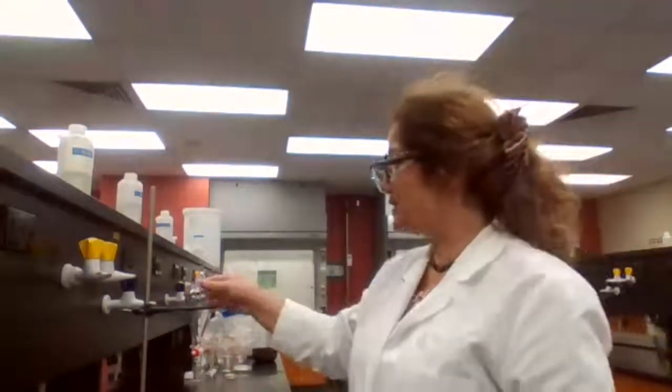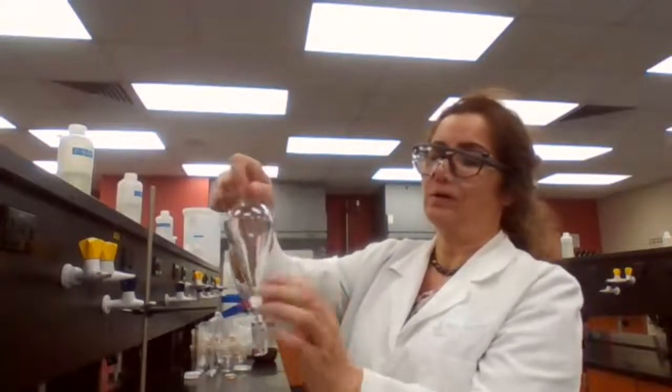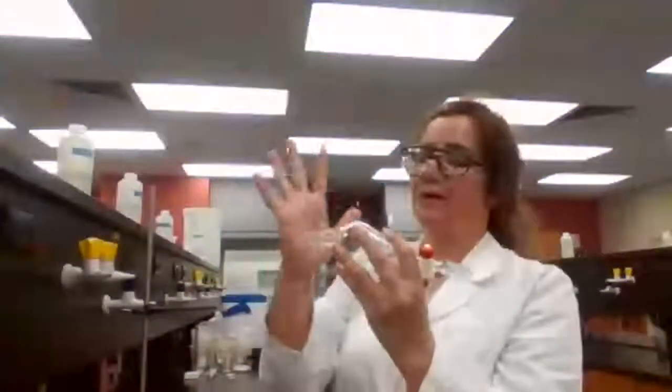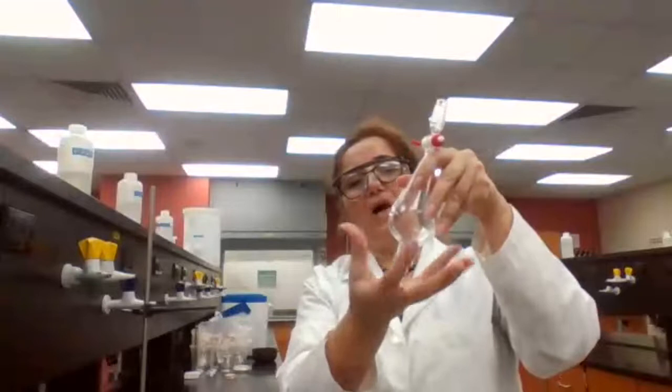But consecutive extraction means that first you add your extracting solvent, and then you are going to shake it. Make sure the stopper is greased and closed, and the stopcock is closed. You hold the separatory funnel against the palm of your hand like this, and that's why it needs to be greased, because if it's not greased, the stopper is loose, and since you are inverting like this, it is going to open, and some of the solution is going to spill on your hand, and that's not what you want to do.